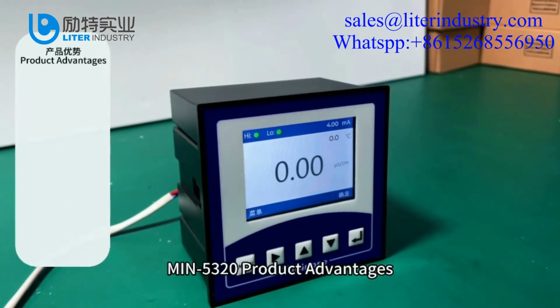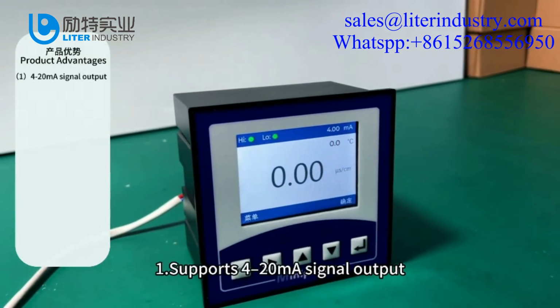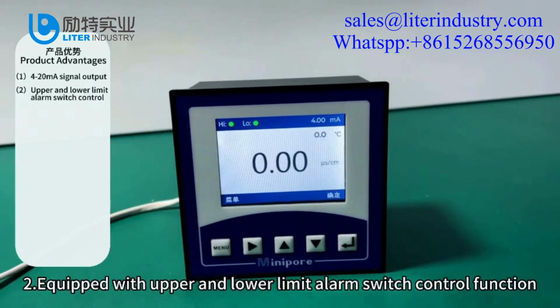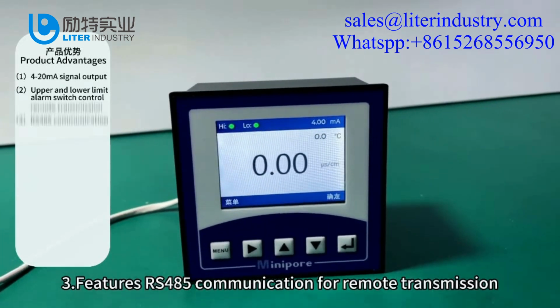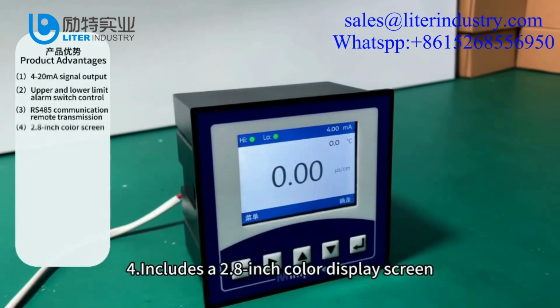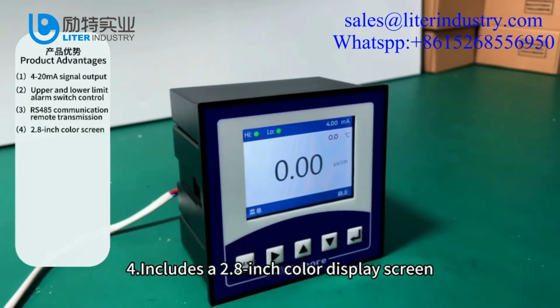MIN. 1. Supports 4 to 20 mA signal output. 2. Equipped with upper and lower limit alarm switch control function. 3. Features RS485 communication for remote transmission. 4. Includes a 2.8-inch color display screen.